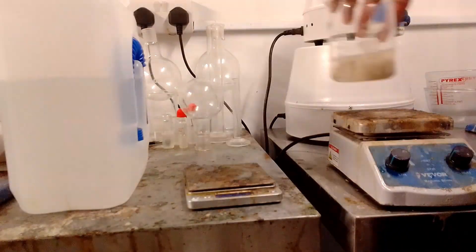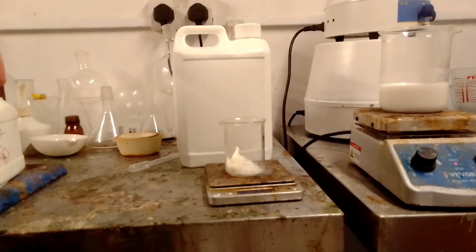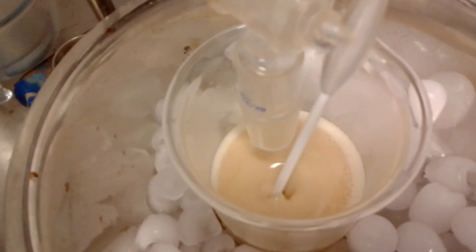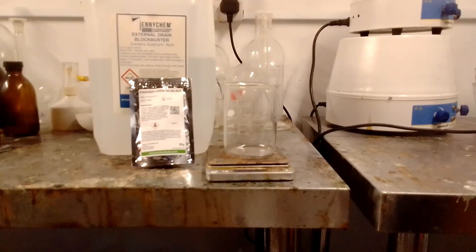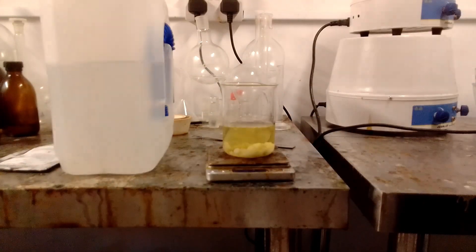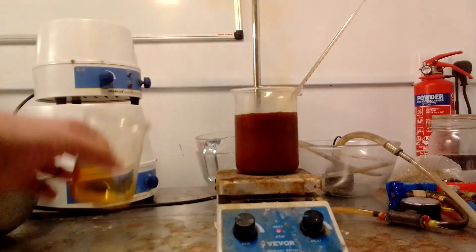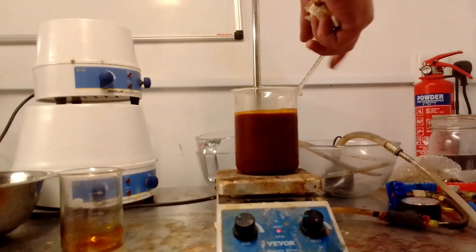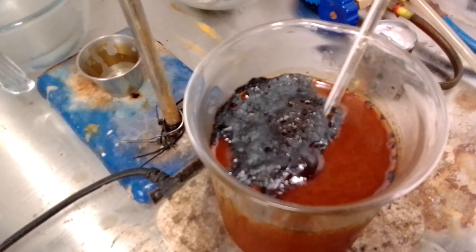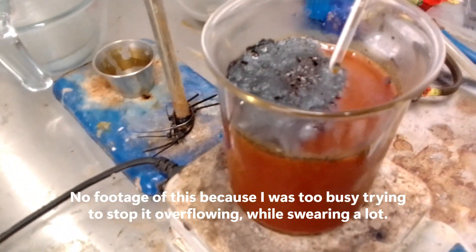Anthranilic acid was suspended in 130g of sulfuric acid, then cooled in the fridge. Sodium nitrite was dissolved in 30g of water, then cooled in the fridge. When both mixtures were sufficiently cold, the anthranilic acid suspension was placed in an ice bath and the sodium nitrite solution was added to it dropwise, making sure to keep the temperature below 10 degrees. While this was being carried out, potassium iodide was dissolved in 130g of sulfuric acid, creating a solution of hydroiodic acid. Once the nitrite addition was complete, the hydroiodic acid was added to the mixture, causing it to turn dark, form some nitrogen dioxide fumes, and form elemental iodine.